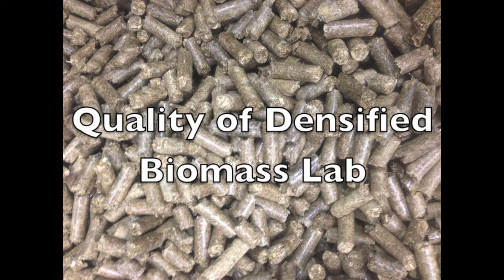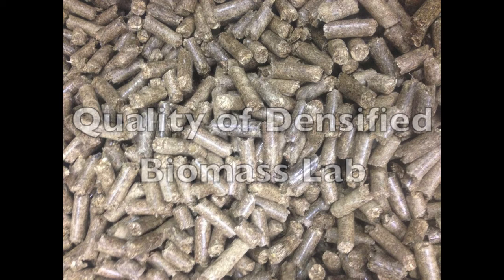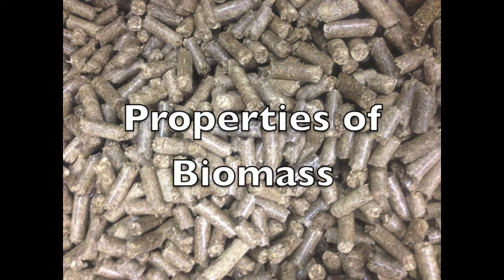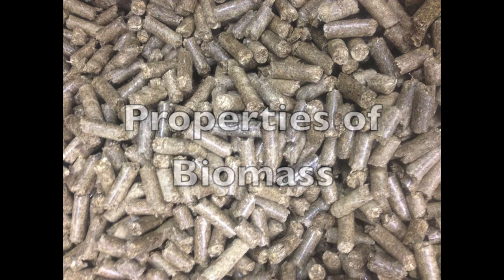Welcome to the Quality of Densified Biomass Lab introductory video. Raw biomass has a low density and therefore is not economical to transport or store. Unprocessed biomass also has different sized particles that tend to knit together, which impairs flow properties, creating variation in bulk density and moisture content. This can lead to dust generation or even self-combustion during storage.